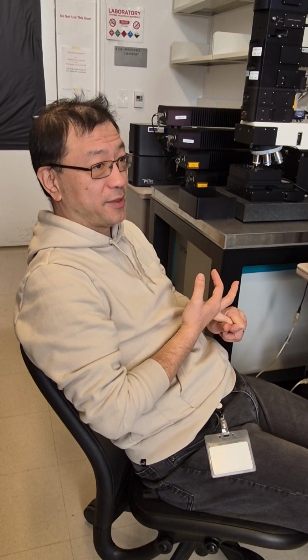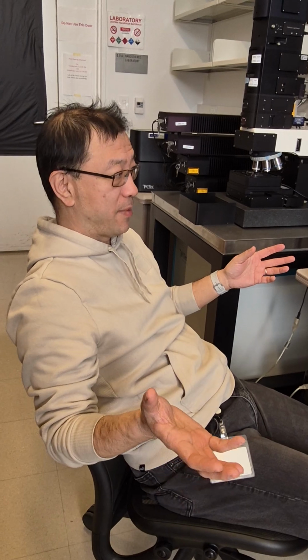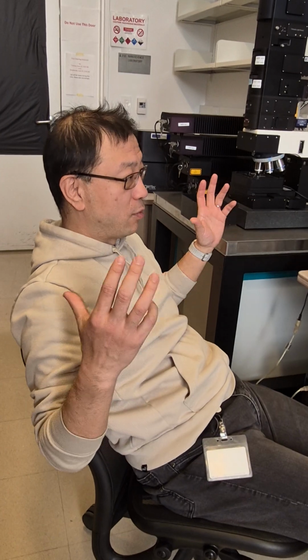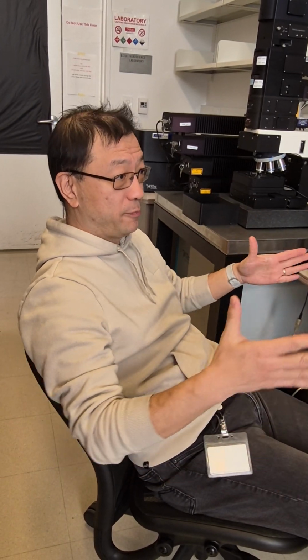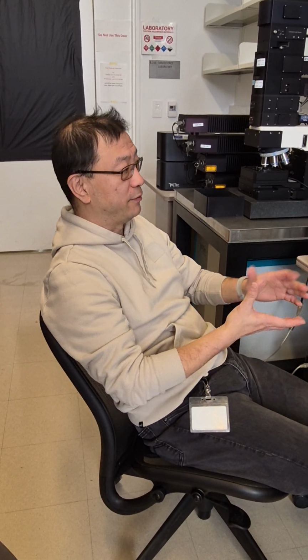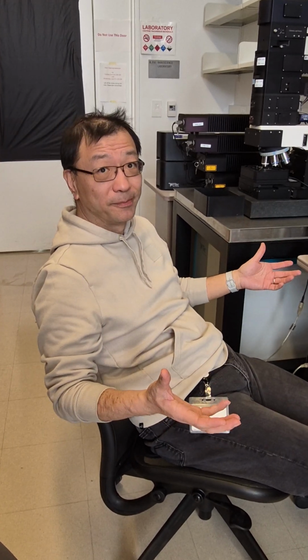So you must know what spectra you are expecting, and which compound this spectra is from. You need to find the standard spectra from the literature, or from the database, or from similar samples that are published by others, published by yourself, published by your lab. And you have an idea of what type of spectra and which peak you are looking for. And then you come in and you do the experiment. Otherwise, you put a sample in, you won't benefit from that. Raman is different. You need to do a lot of homework. You also need to know why the sample gives you the Raman.